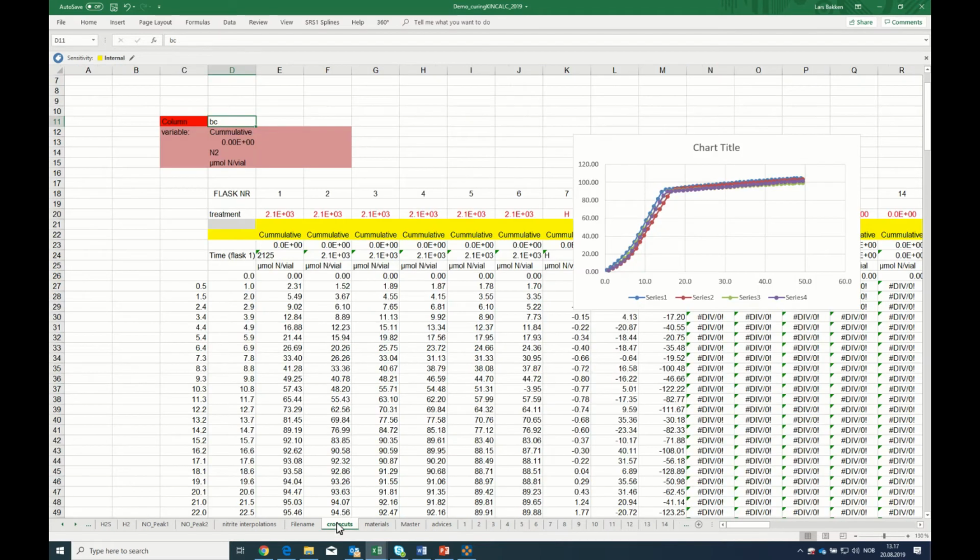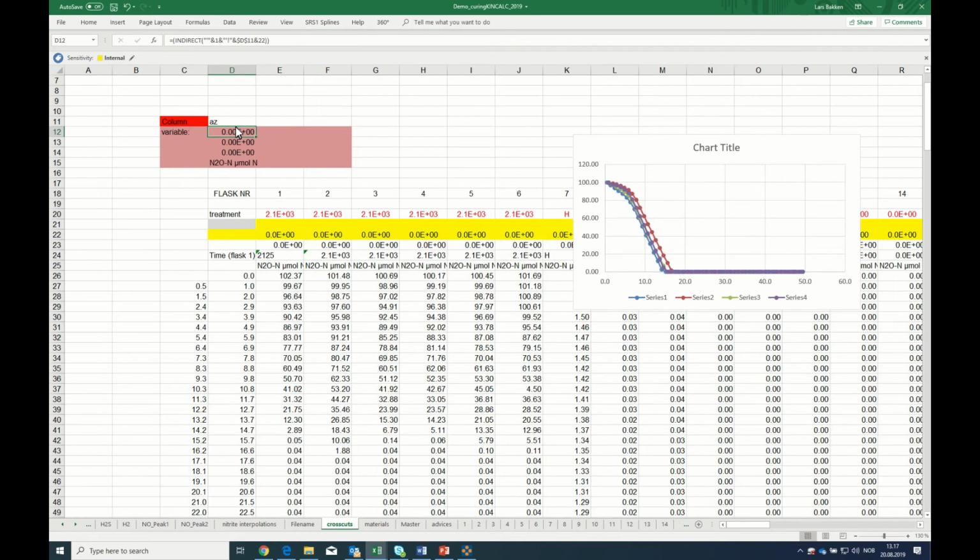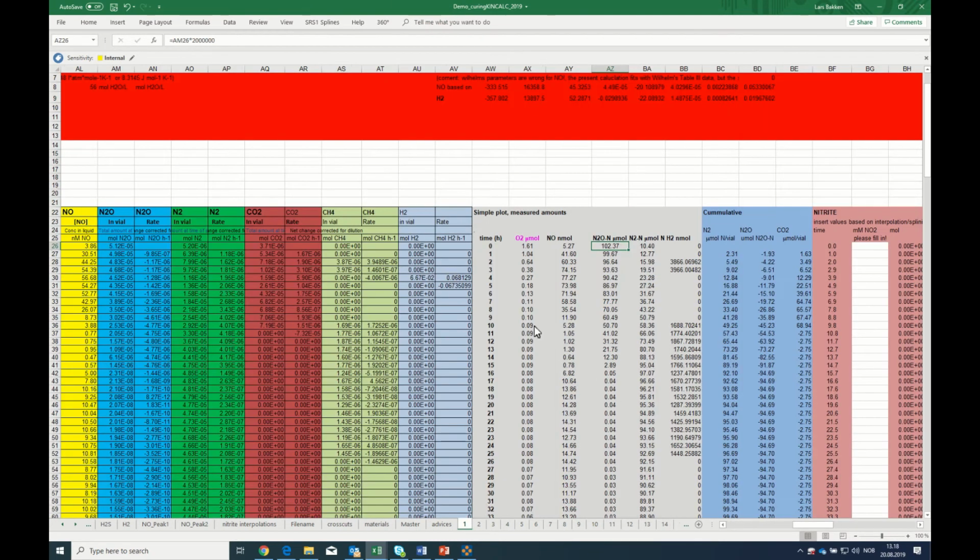So go back to crosscuts, and I write AZ here, and then all of a sudden you see the curves. This is a plot of the different vials. So you see all the vials plotted in the same plot, and you can go to another column. Say that I want to see how quickly they use the remaining oxygen. There is always a little bit of oxygen to begin with. Even if we intend to make it anaerobic, there is 1.6 micromole of oxygen to begin with in this case.